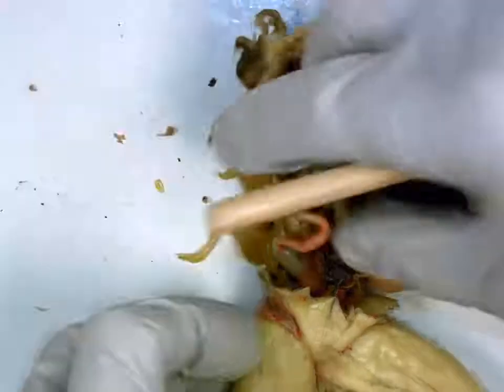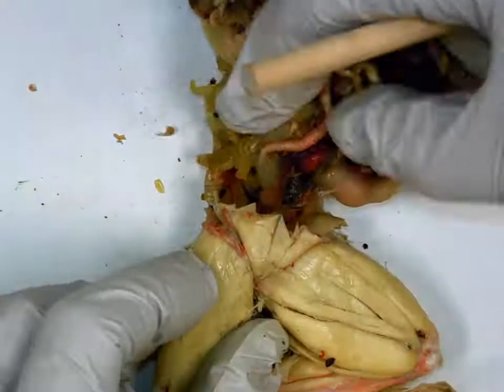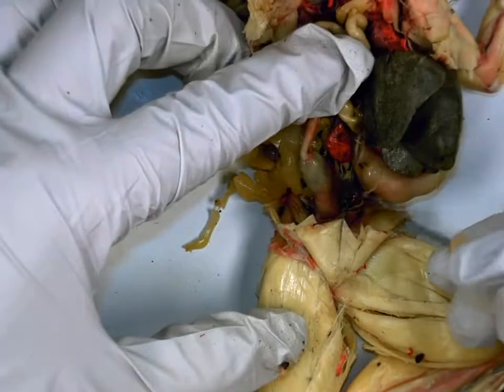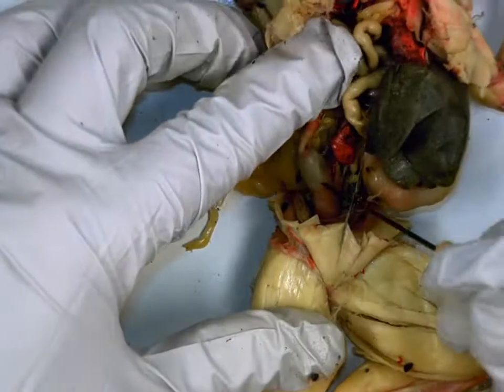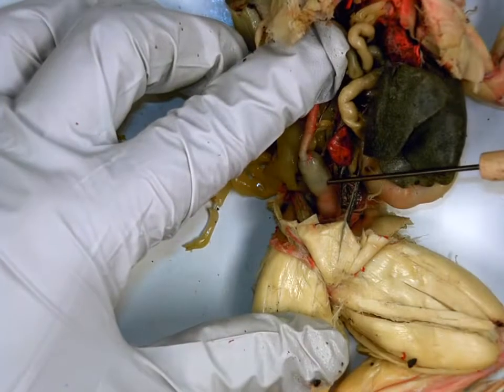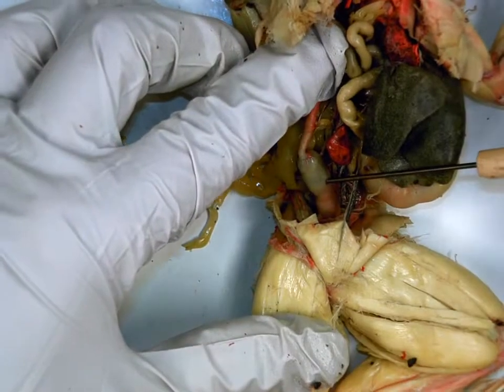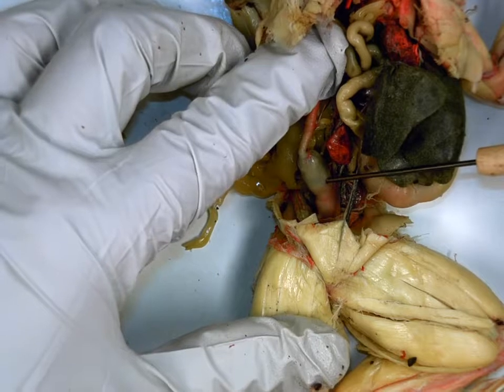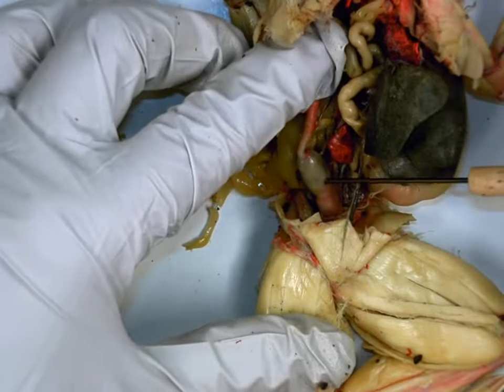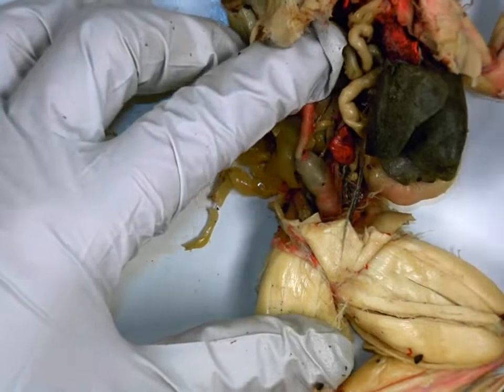Now, if you follow the skinny tube of your frog, you should see it come to what looks like a short, thicker tube at the very end. What is this? Large intestine. What is its function? To pack the feces and absorb water. So it removes the water from the feces and packs it. Okay? And that was the entire digestive tract.